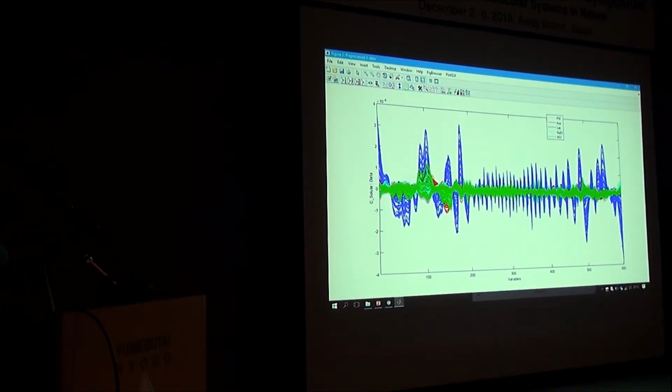But then you can do the weighting separately for different components, like different solvent solutions. Yes, but what I decided to do with the replicates was to use all replicates, no matter what they are, because they're the same thing. And I got the best result when I included all of them. I tried just water, just... So finding the dimensions that are disturbing everywhere, we want to remove those and keep the information that is there. But how to optimize, that is not easy, finding the right thing.